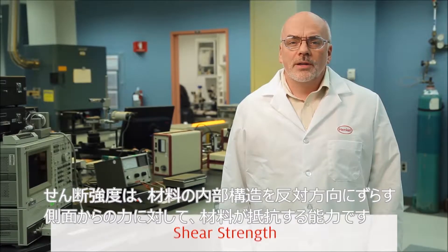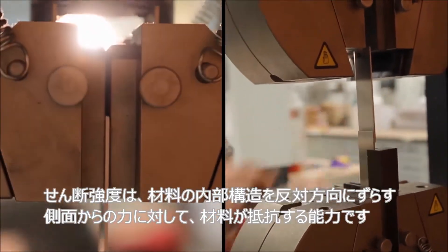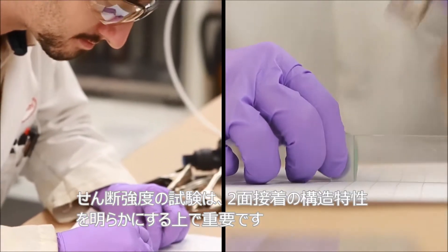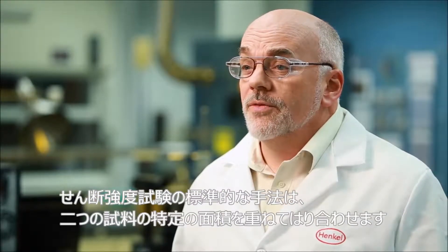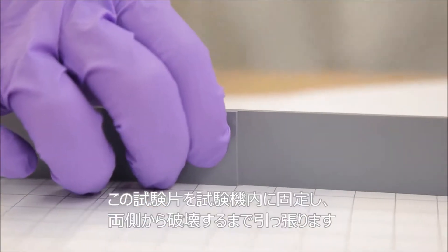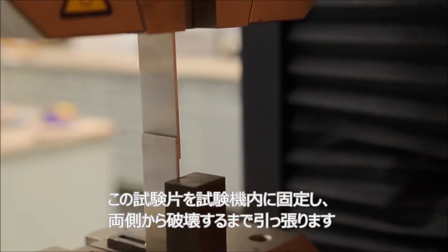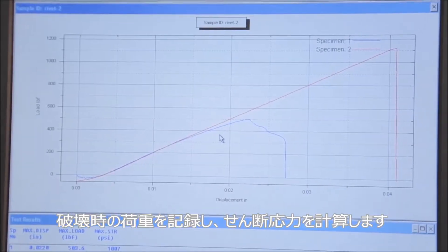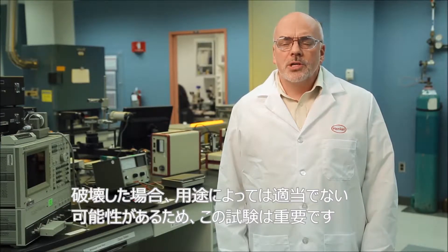Shear strength is the ability of a material to resist lateral forces that cause the internal structure of the material to slide against itself. Adhesive shear strength tests are important for characterizing the structural integrity of a bond between two surfaces. One standard method calls for bonding two test specimens overlapped by a specified area, securing the assembly in a mechanical properties tester, and pulling in shear until failure. We record the load at breakpoint and calculate the corresponding shear stress. This is important because if a material fails at lower strengths, it may not be suitable for some applications.